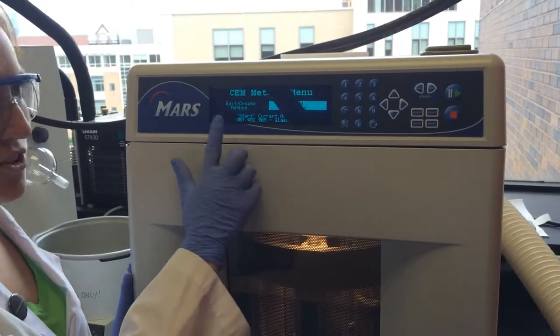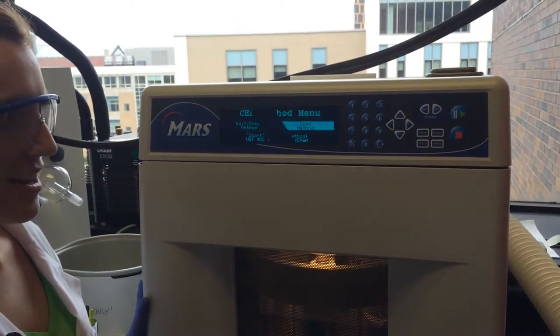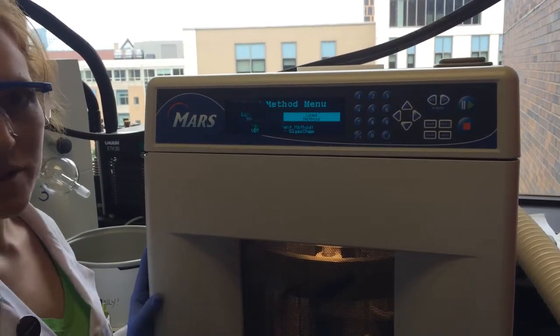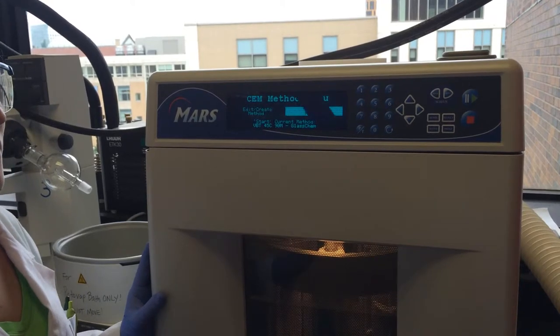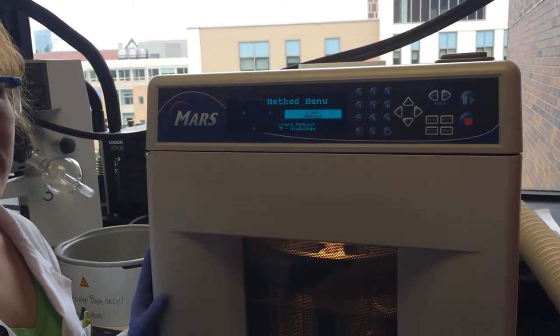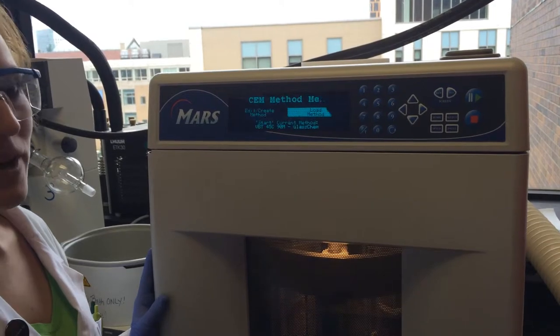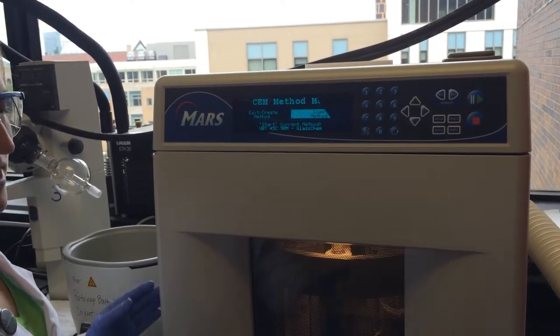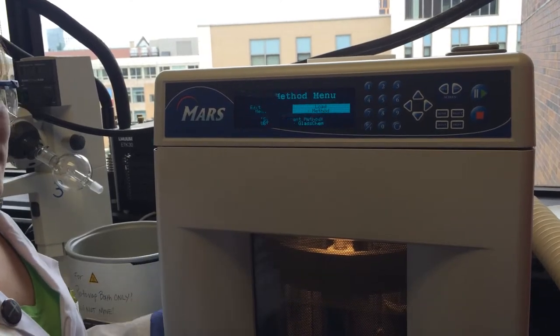If you would like to create your own method, there is another video on how to do that. And also, when you first press the play button, there is a 5 minute warm up period and a 15 minute cool down period after your run. So, for every run you put into the microwave, you have to add 20 minutes to the run time in order to have an accurate timing of how long it will be inside the microwave.